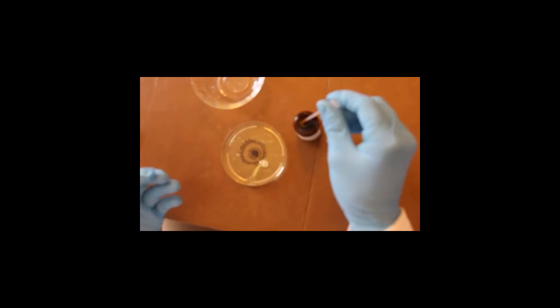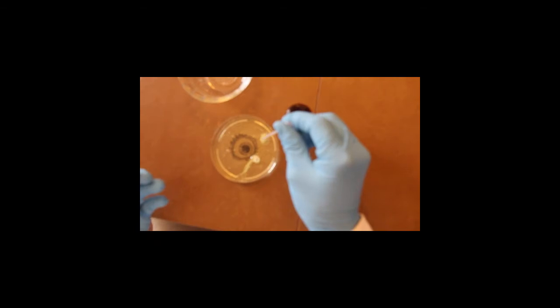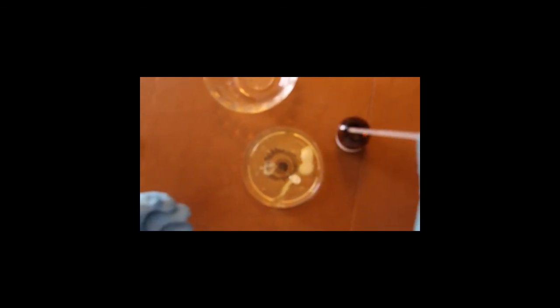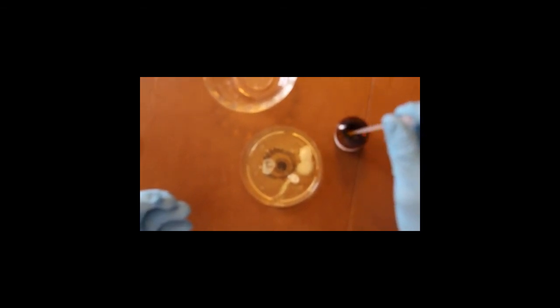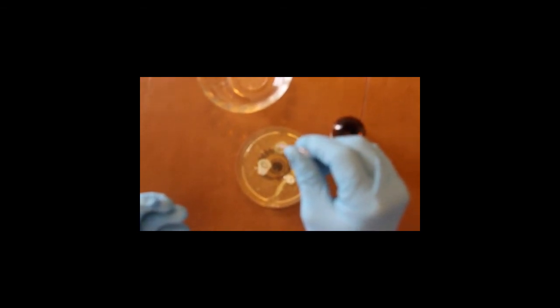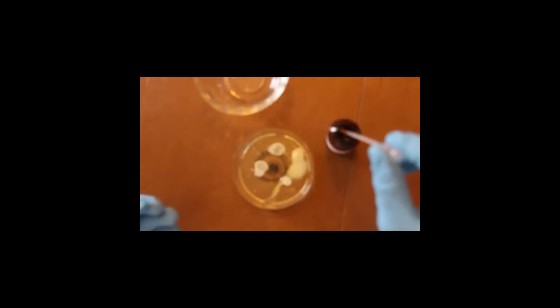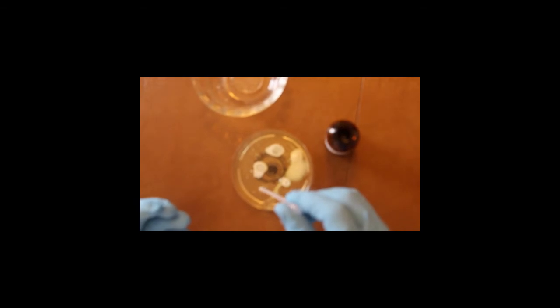And as you can see, it's cooking the egg just like you would cook it on a stove. You can see it's turning that white. And again, this is a really good hands-on demonstration of what the consequences are when an accident could occur with this sulfuric acid. This is very corrosive, dangerous stuff, and we want to use the utmost safety when we're doing this.